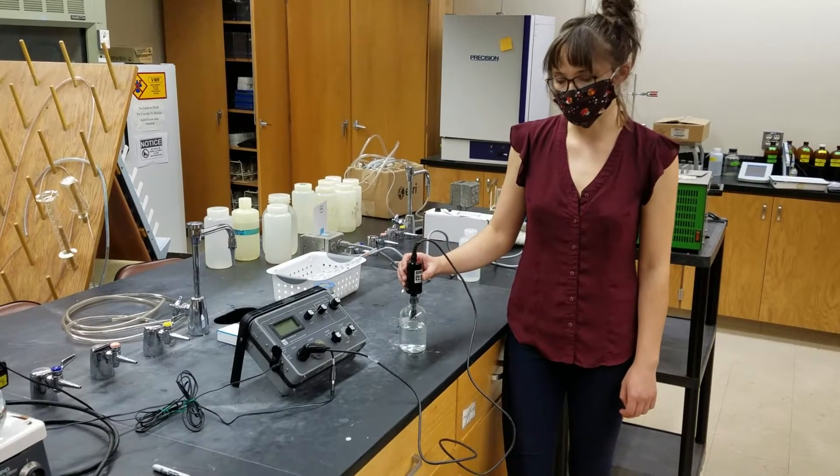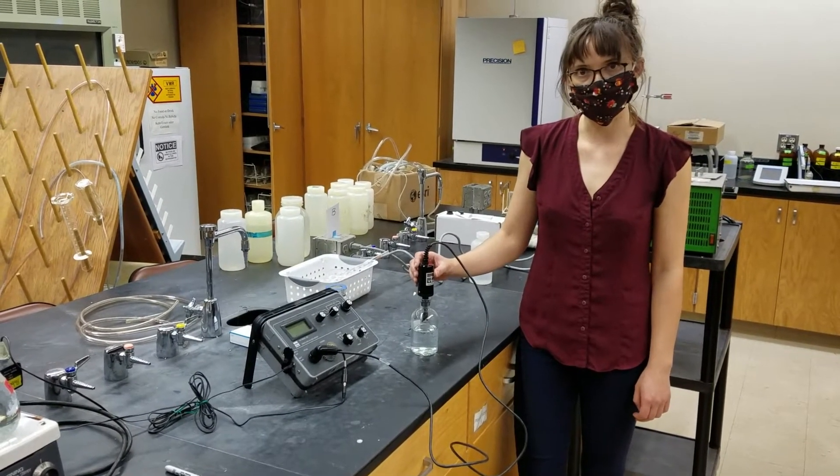Okay, so this is our dissolved oxygen probe, and I'm going to show you how to calibrate it.